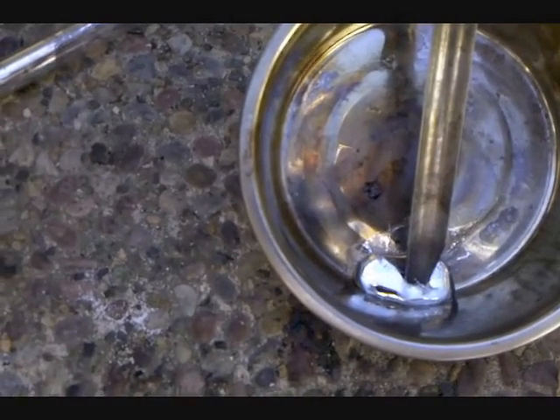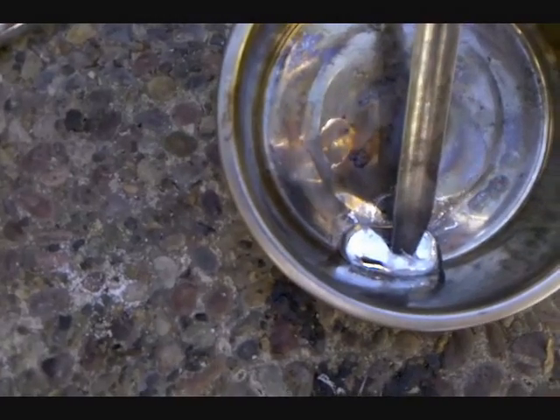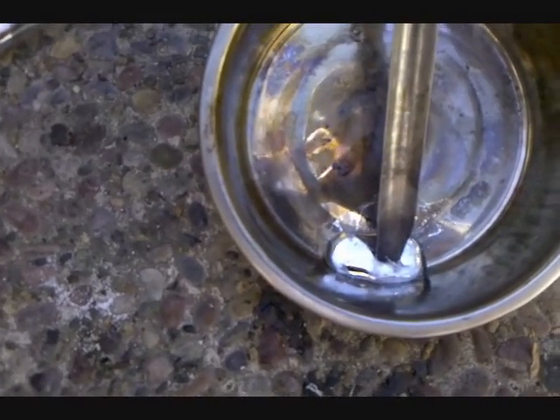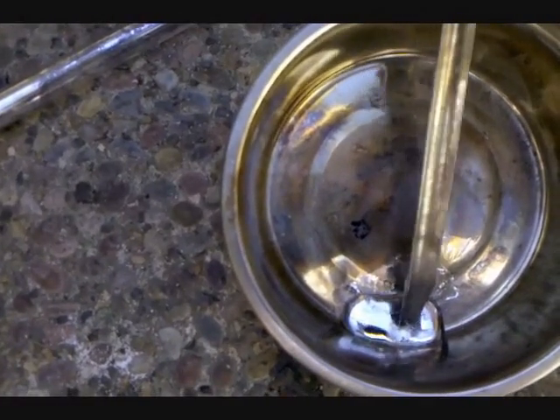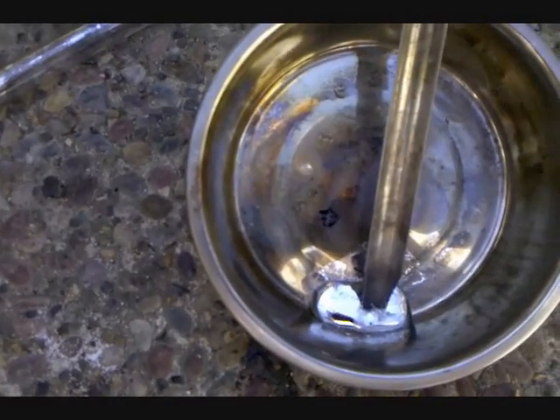What's going to happen is because the aluminum is in an alloy that's liquid at room temperature — the gallium-aluminum alloy — it's not going to be able to form a protective layer. And because of this, it's going to react quite vigorously, as we'll see later.